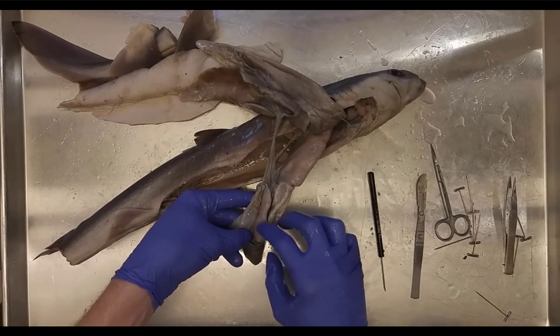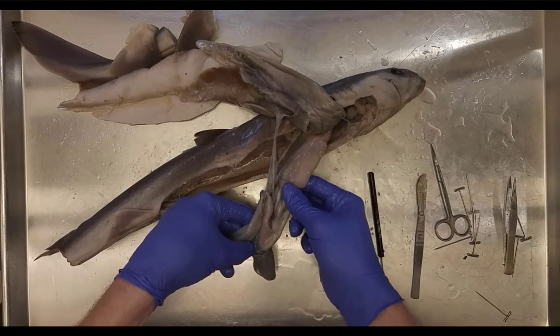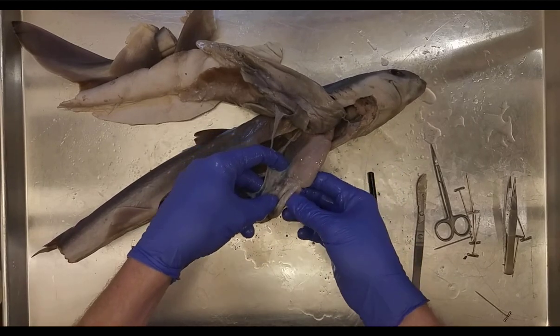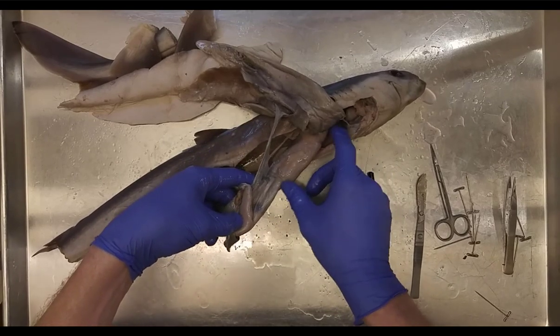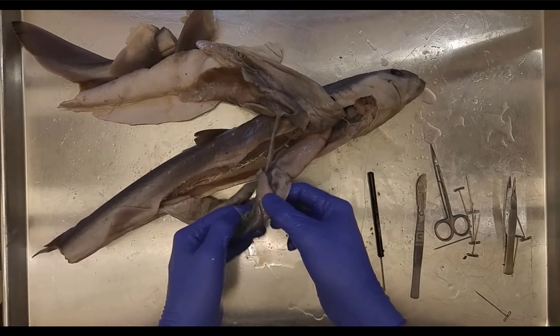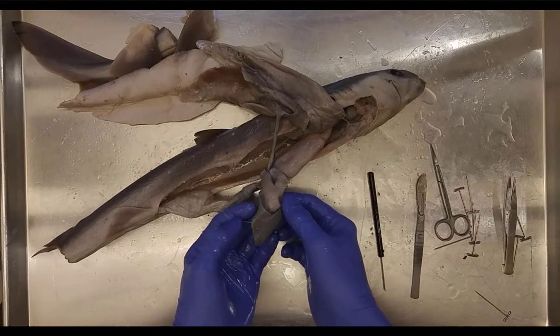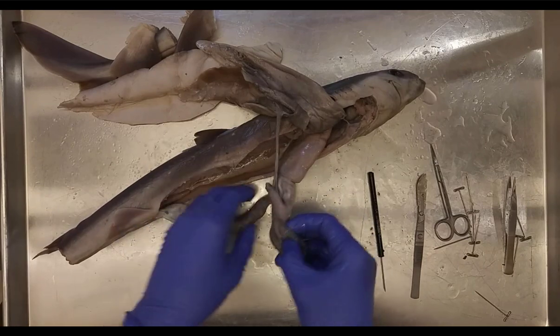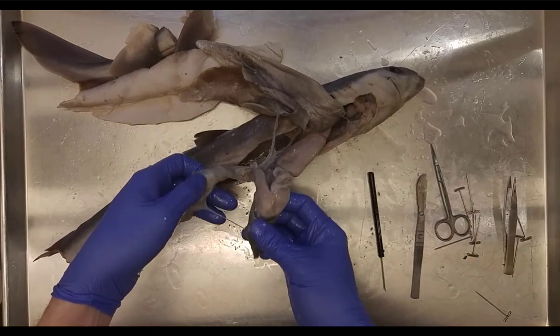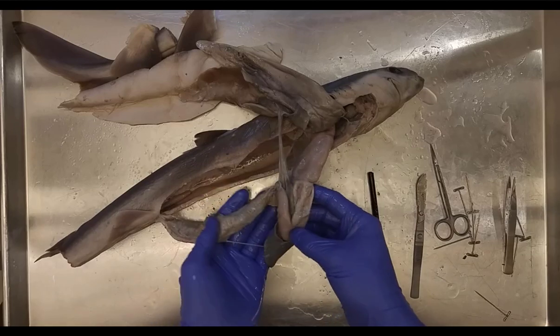The stomach is J-shaped. There appears to be a constriction between the esophagus and the stomach — possibly food inside. At the apex of the J you have the spleen, a gray organ important for recycling red blood cells and producing an immune response. These organs all serve multiple functions, but we'll focus on one or two primary functions for simplicity.